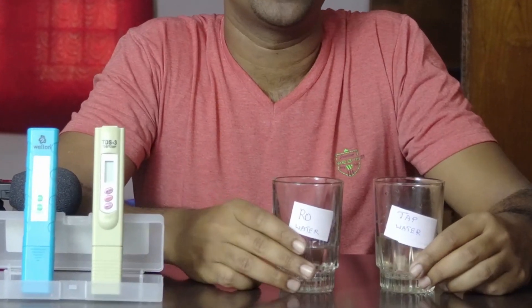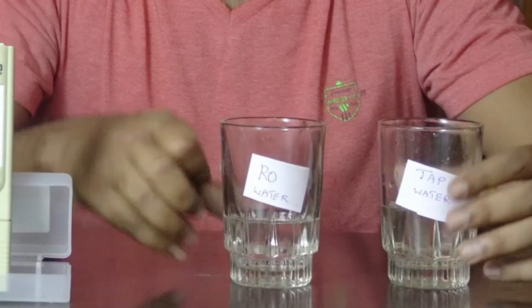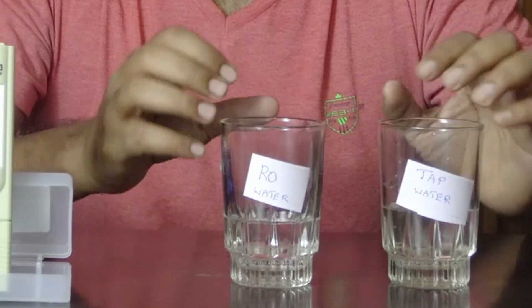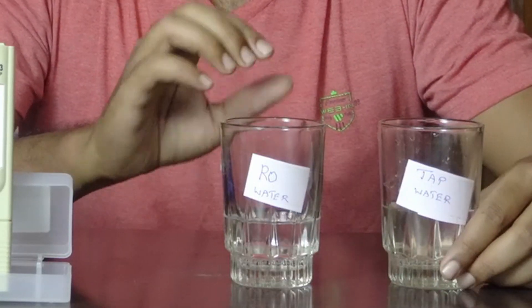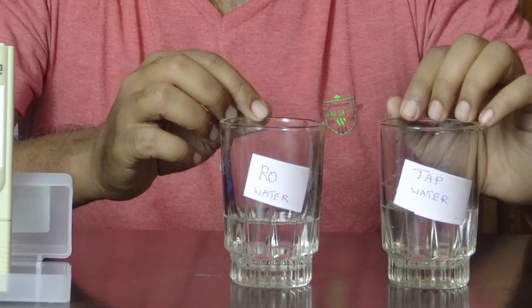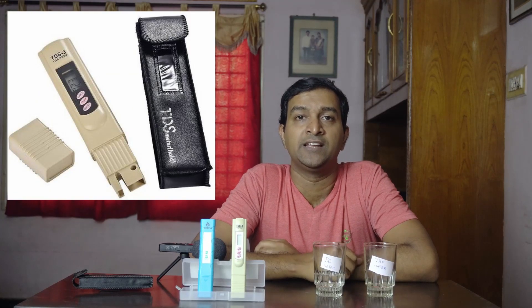Here we use two types of water: one is tap water — normal metro water — and one is RO water. So let's check the two values. One is TDS.